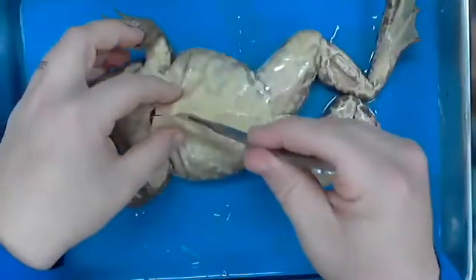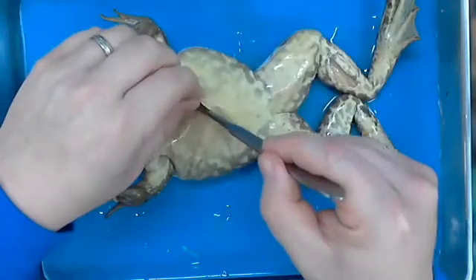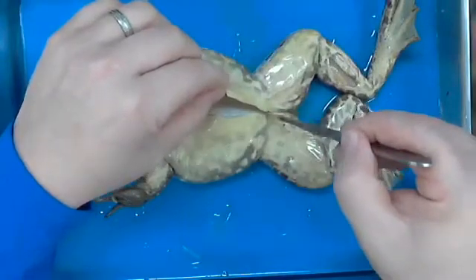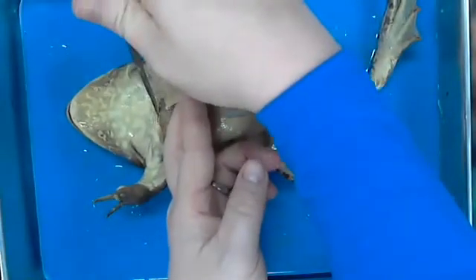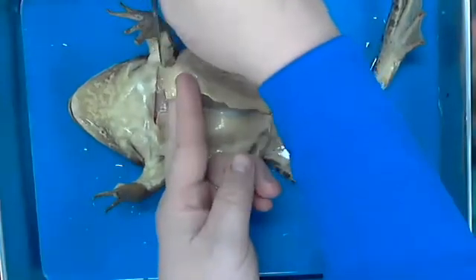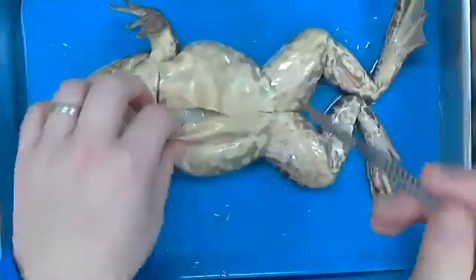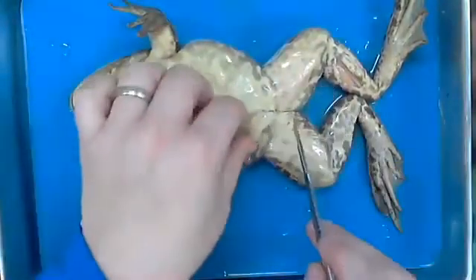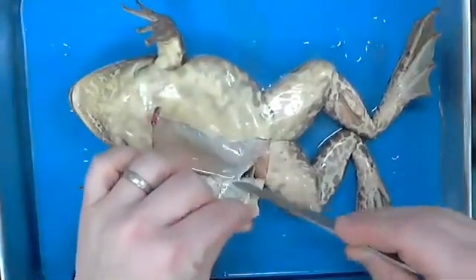All right, so I'm going to go ahead and just get his skin out of the way just so that everybody has a chance really to take a look at this. If you were doing this for me, you pretty much would not be using a scalpel. There'd be no need. I'd just pretty much have you cut with a pair of scissors, okay? But more or less what I'm going to do, and this is the same thing that would happen for Claire, let's say if she's in the surgery or whatever else, is that she's going to create releasing incisions to be able to actually get stuff out of the way. So you kind of quickly realize how animals and ourselves are put together from the standpoint of how little it takes to be able to take us apart. We're not really any different than this animal here.